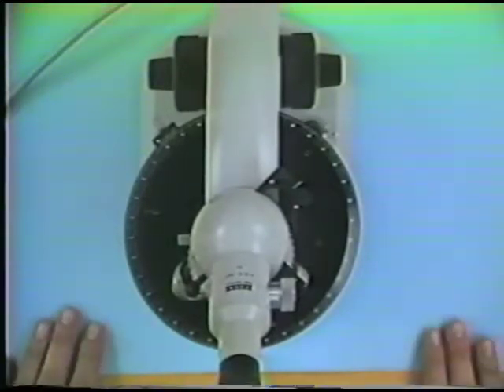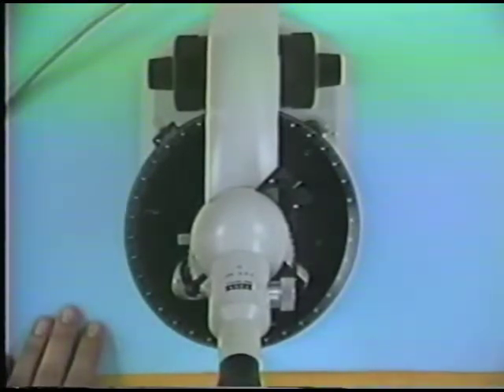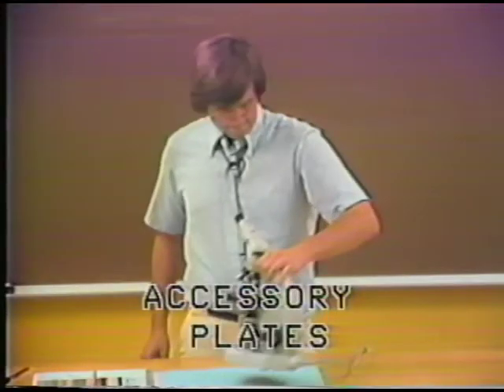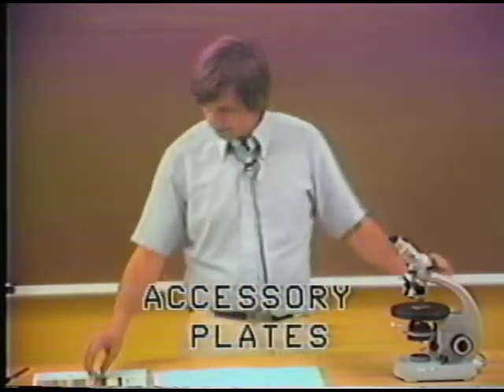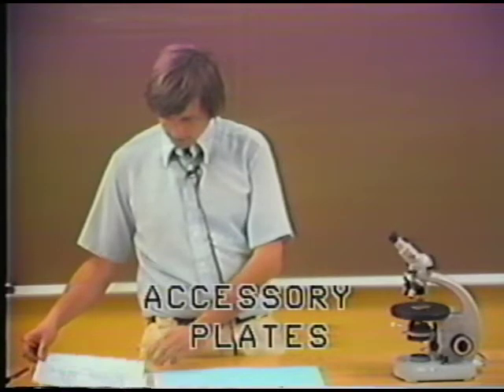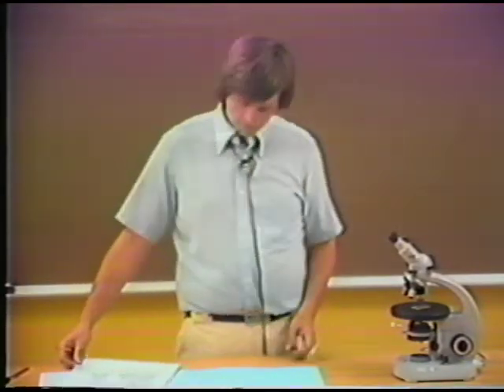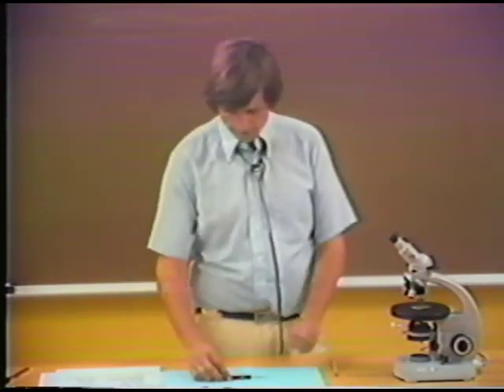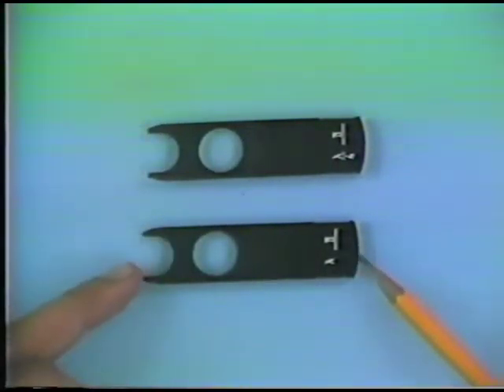Well, the next thing I want to do is to demonstrate the use of accessory plates. Just to refresh your memory about accessory plates, we actually have three kinds of accessory plates. We have the gypsum plate and the mica plate, which look very, very similar.